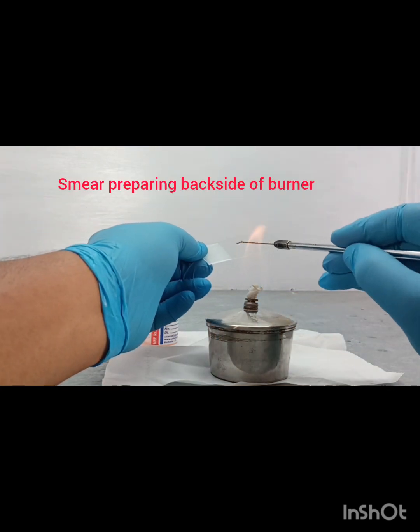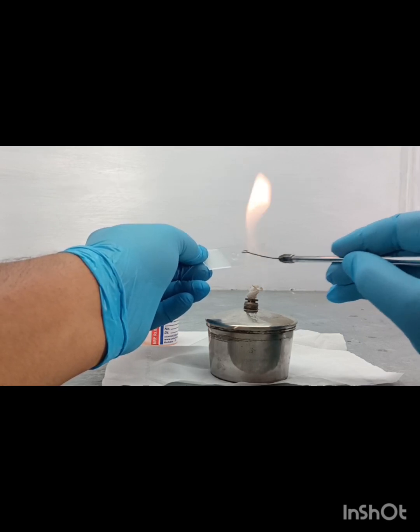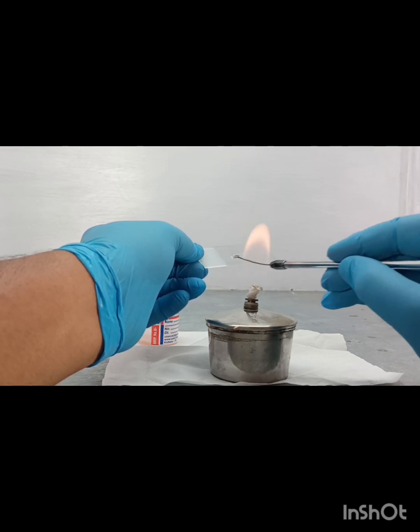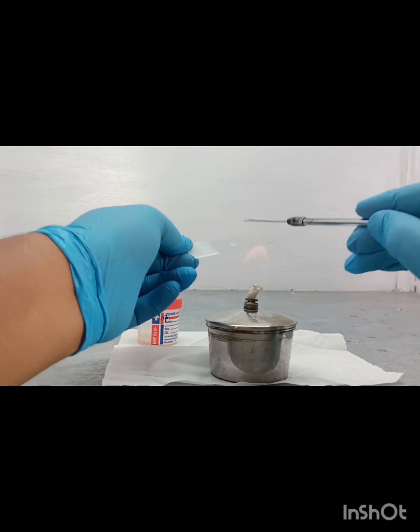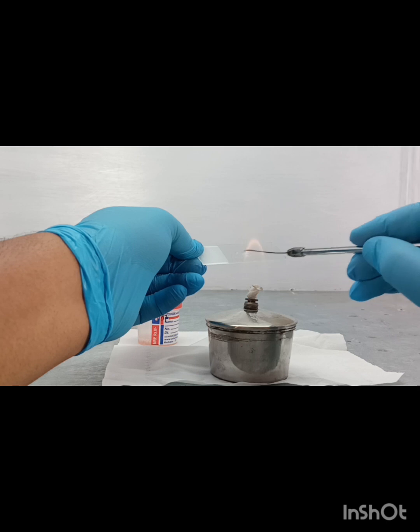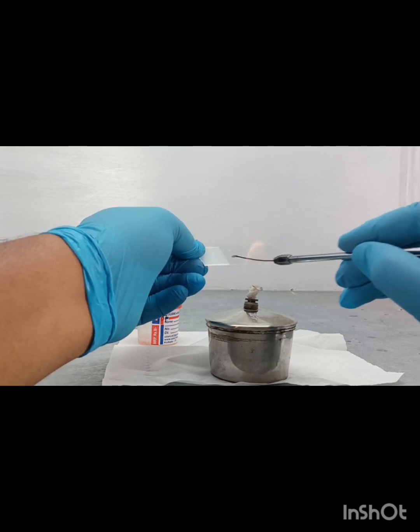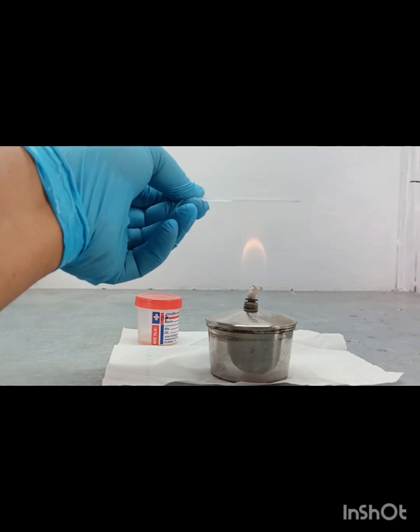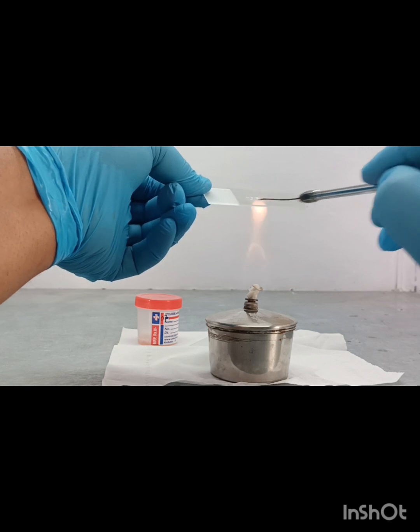So like this. Okay. At that time we also heat fix it.